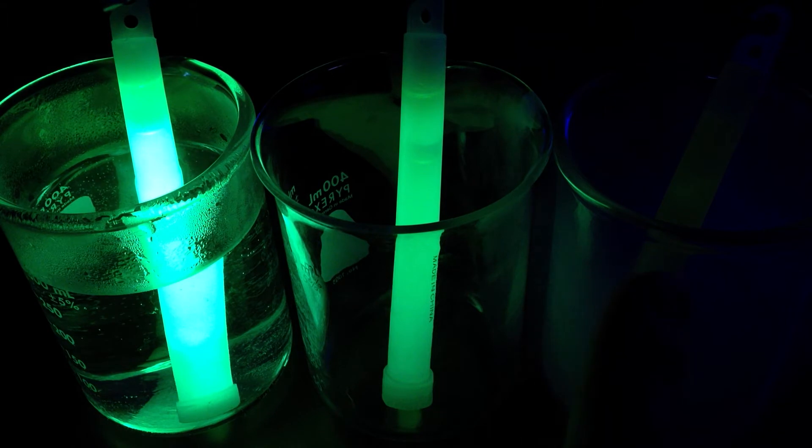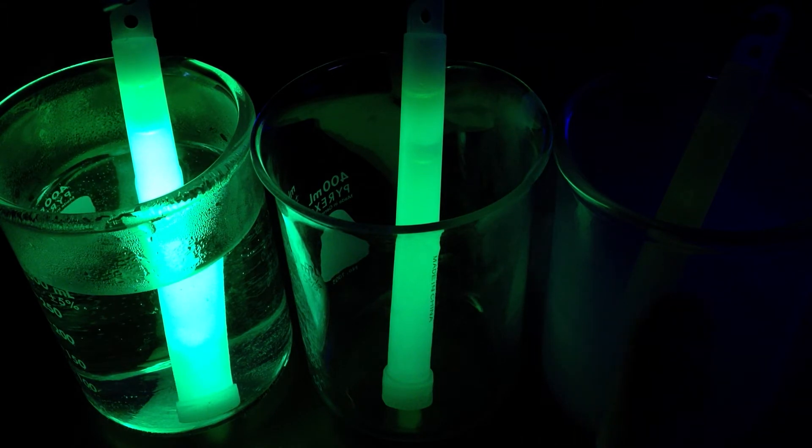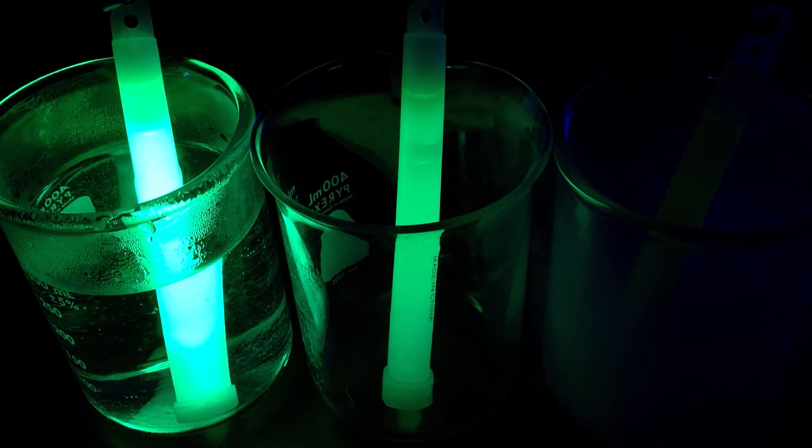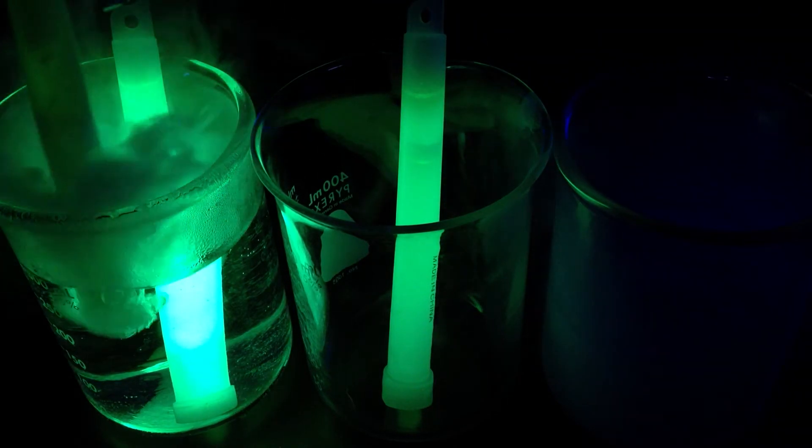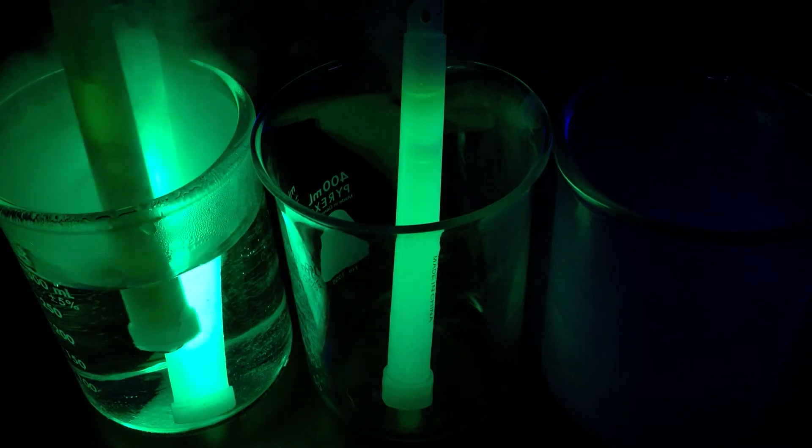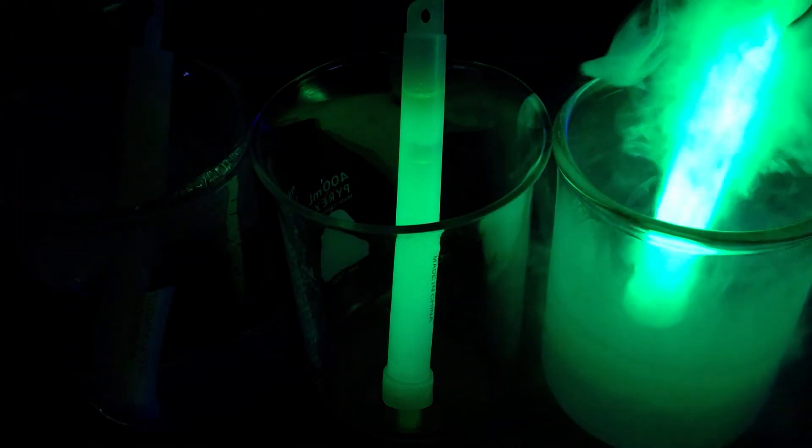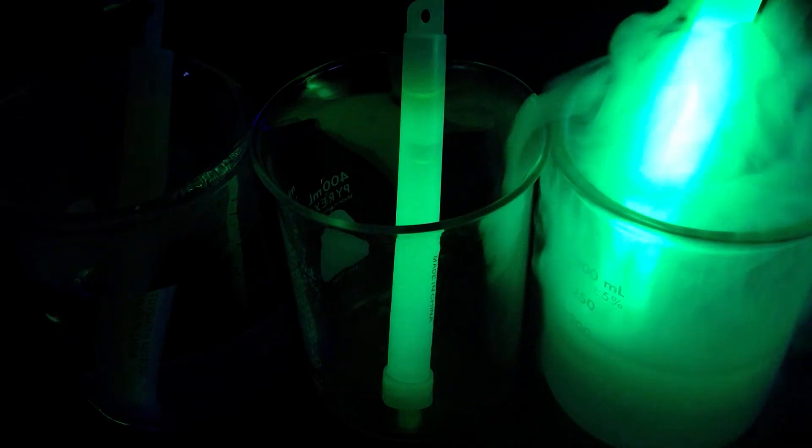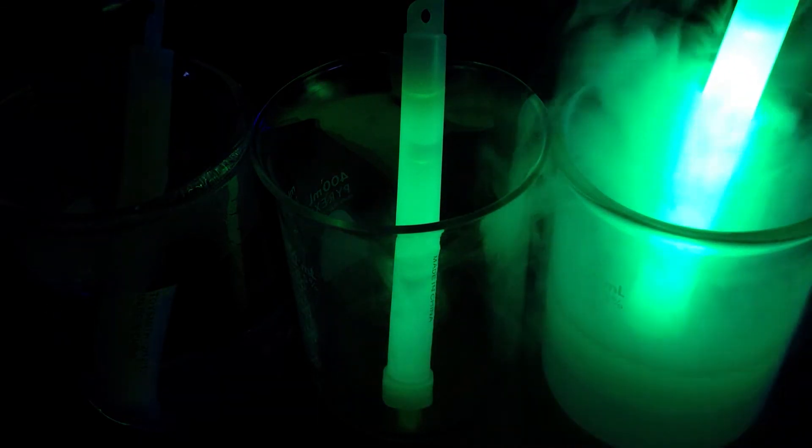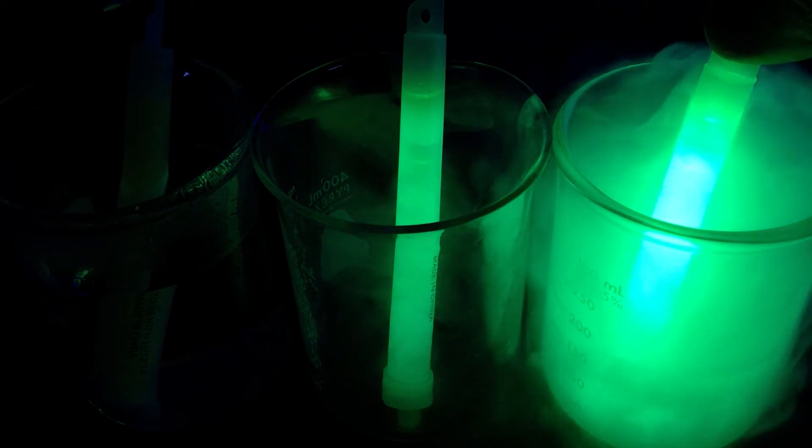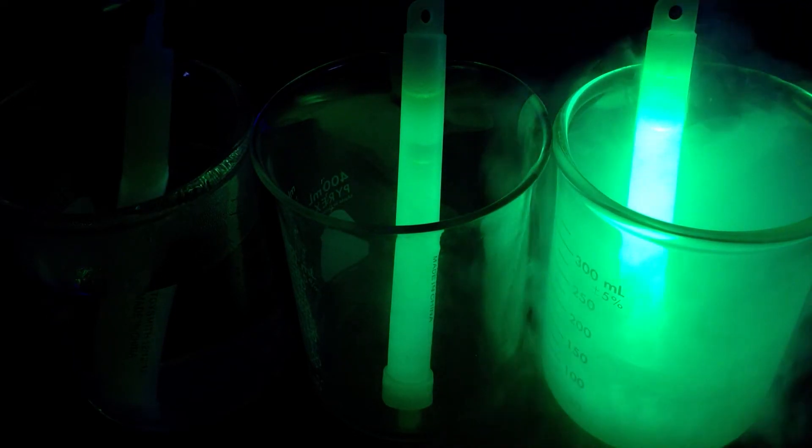And as the temperature decreases, you can see that the luminescence, or the rate of reaction, drops, less light being produced. Now, interesting enough, I can switch these. Put this one into the warm water, and put this bright one into the liquid nitrogen. Kind of cool to watch the fog kind of glow here.